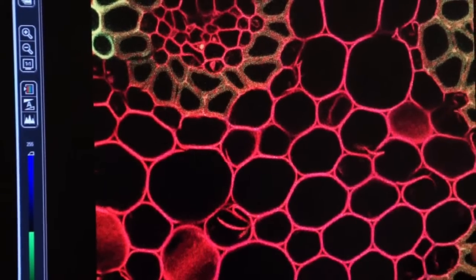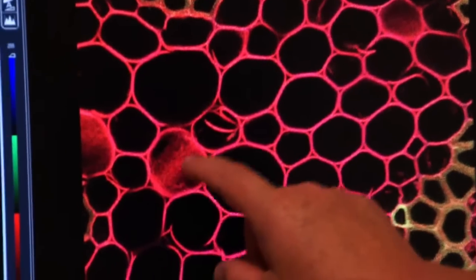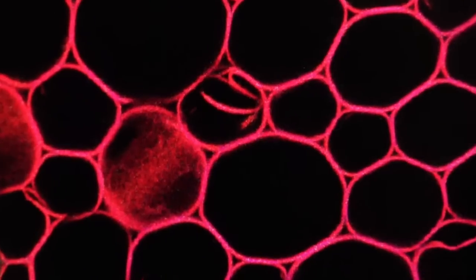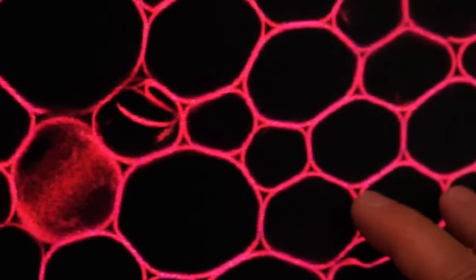Here you see the pixelation has gone away. This is an 8K by 8K image. We have a lot of fine detail resolved in here, and a lot of the noise is gone because we did line averaging of 5 scans per line.